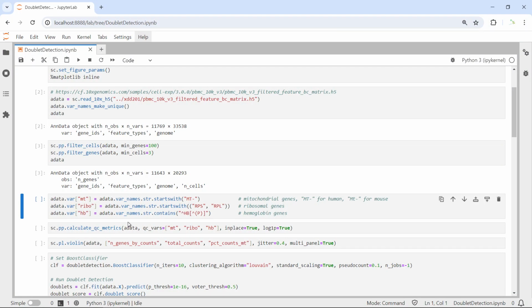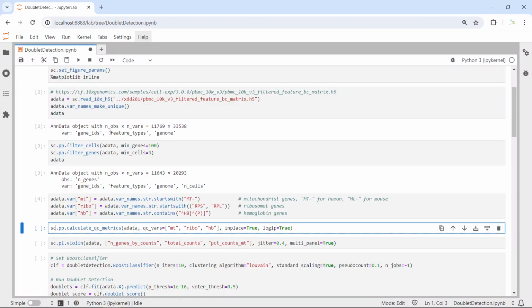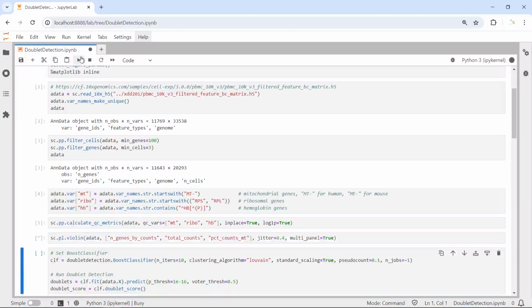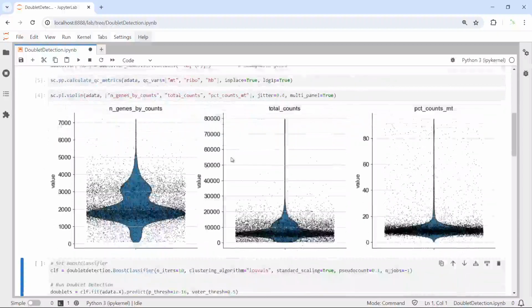First, we need to get the gene information for mitochondria genes, ribosome genes, and hemoglobin genes. Let's get the gene information. Then we can calculate the quality control metrics. After that, we can use the violin plot to look at the quality control metrics. For example, here we are going to look at the n genes by counts, total counts, and the percentage of mitochondria DNA. Let's make the violin plot. You can see we generated 3 violin plots. The first one is the violin plot for n genes by counts. The second one is the total counts, and the third one is the percentage of mitochondria DNA.